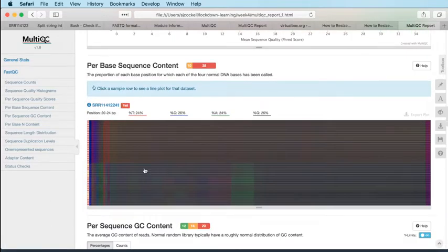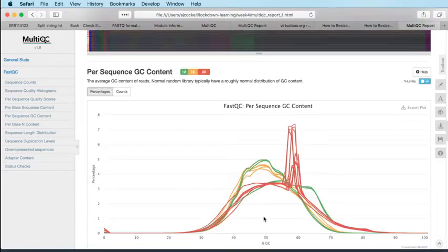I told you that those patterns would be very similar across the whole experiment, and certainly, maybe we're seeing that these two sets of samples are a little bit batchy. That the first set is slightly different from the second set, but again, these are RNA-Seq samples. These are the patterns we expect to see. There's no huge cause for concern here.